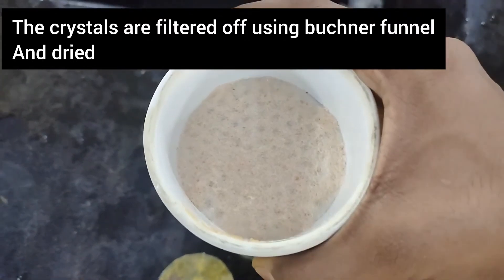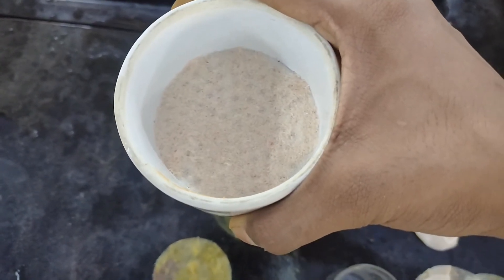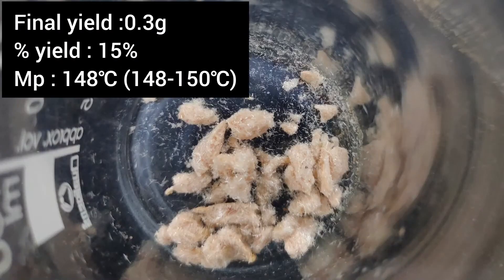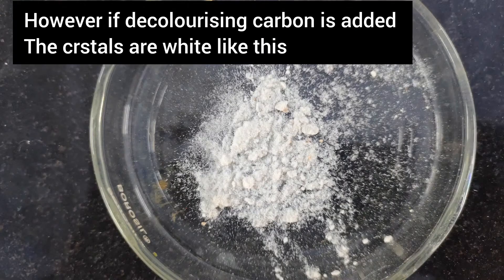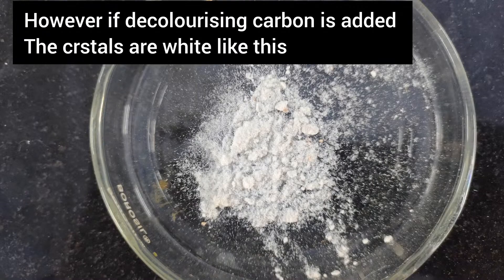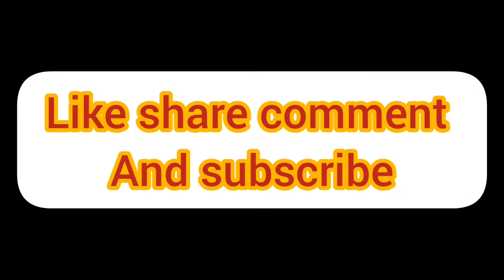This is the recrystallized benzilic acid. The final yield was around 0.3 grams, which corresponds to a percentage yield of 15%, which is quite low. However, if decolorizing carbon is added, the crystals are white like this.